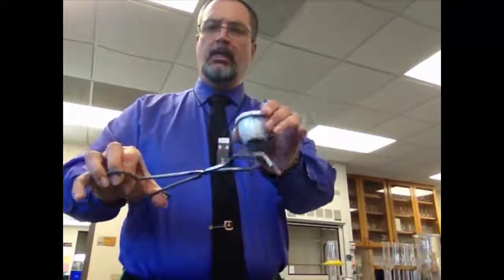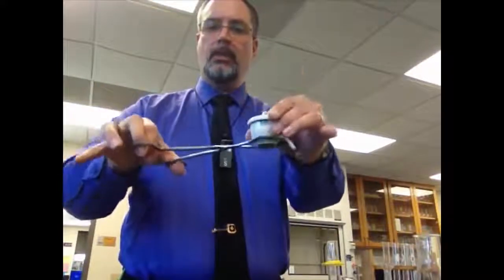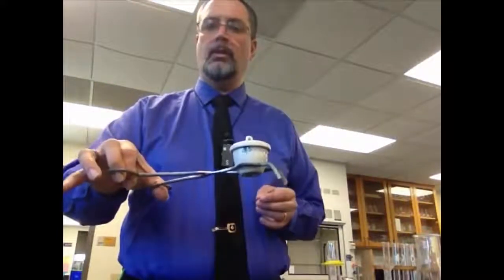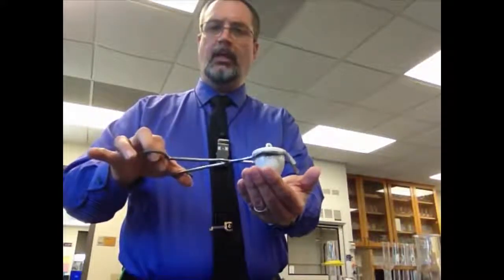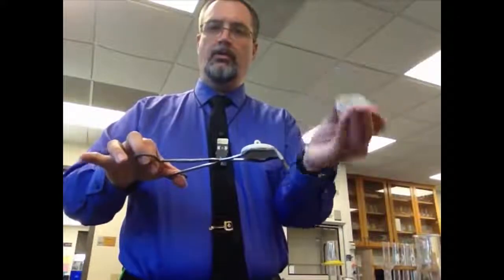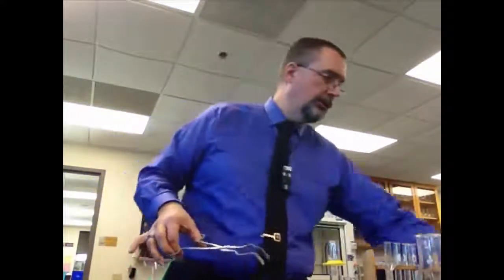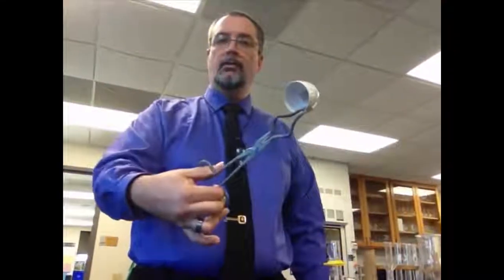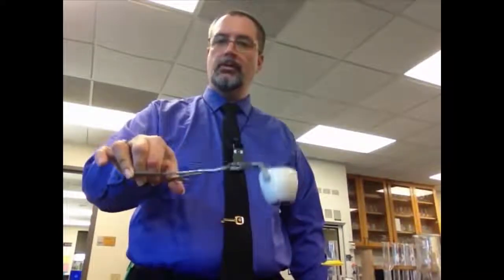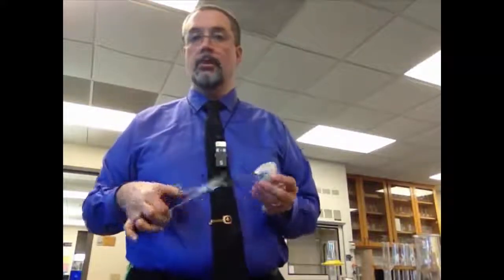And originally, this little weird bent piece in the middle of the crucible tongs was designed to allow the crucible to sit right in there. Unfortunately, if you don't have a steady grip or you relax your hand just a little bit, it'll slip right through and you'll break your crucible. So when we use crucibles, we don't carry the hat around with it, the lid. We just grip it by the sides, and that thing's not going anywhere. It's very, very secure that way. So we can carry it around the lab, we can put it up. We don't want to be touching it with our hands because it's usually going to be very hot. So we can carry it around with the crucible tongs. Pretty easy.